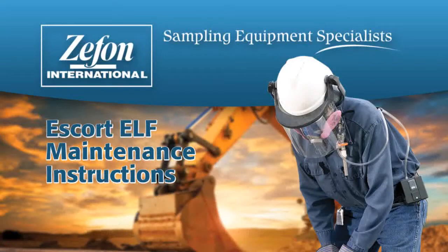This video is a basic guide to the routine maintenance of Zefon's Escort ELF personal air sampling pump. These instructions are also available in the operating manual.